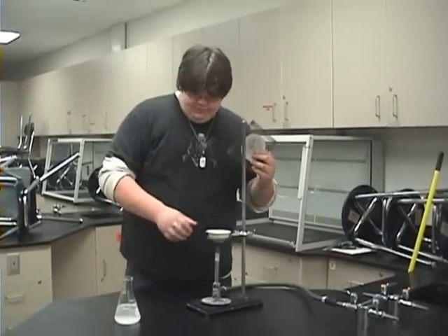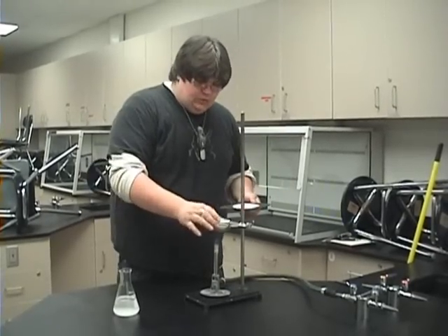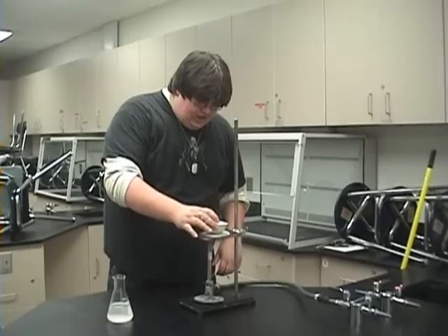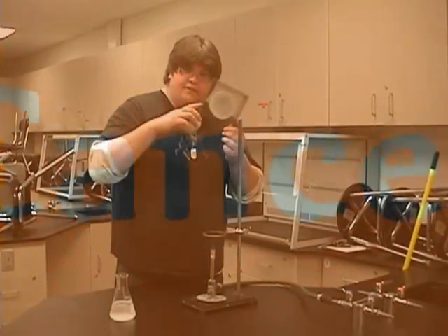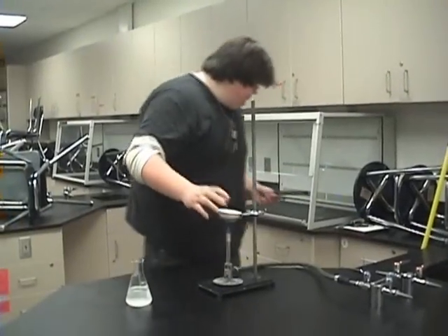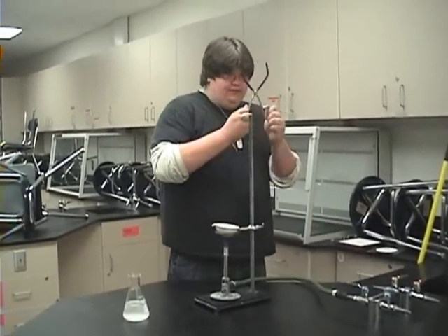This is optional — you can either put this in here like so, or put that right there and that right there. I wouldn't use it; this is why stuff gives you cancer. That is hot — if that gets hot, use the tongs.